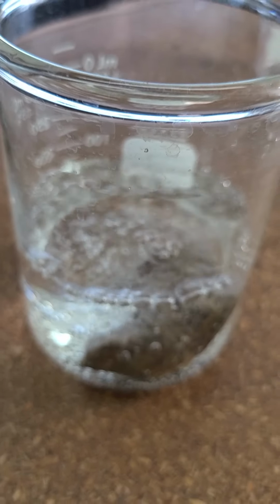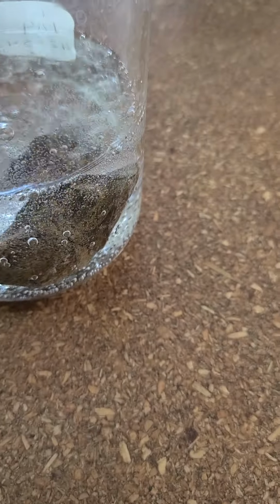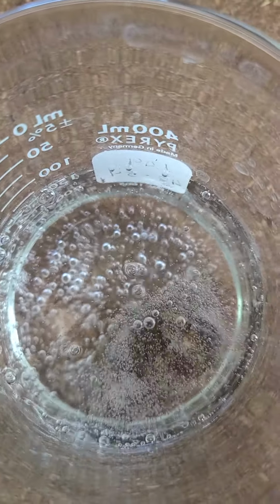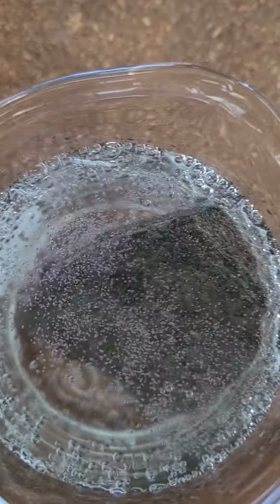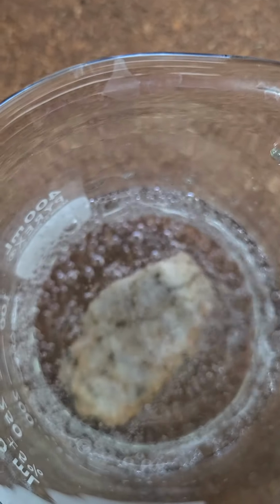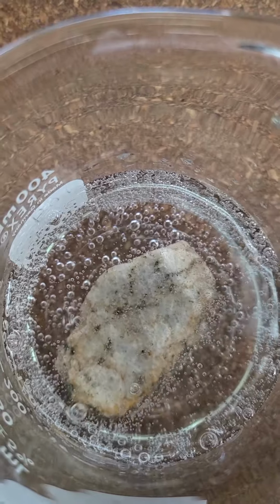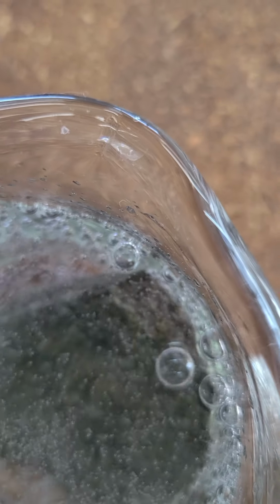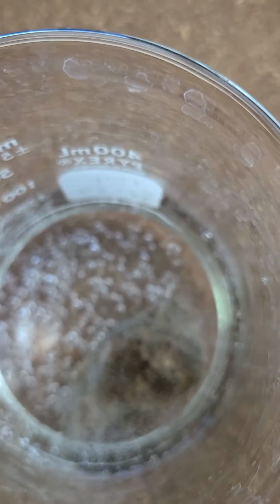Now I don't expect necessarily something to happen immediately, but there's rock type C. Interesting. So right now, if you look inside, there's C. See, it's bubbling pretty good. Still a lot of bubbling going on through there. And maybe still a little bit on this one, right? So there's our acid rain simulation working on this stuff. So we're just going to leave it go. Even when the carbonation finishes, we might still get some action out of it. I'm not expecting it to be immediate, because again, it's not just an instantaneous process.